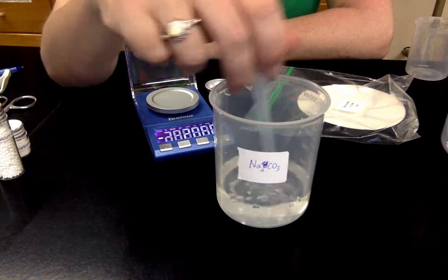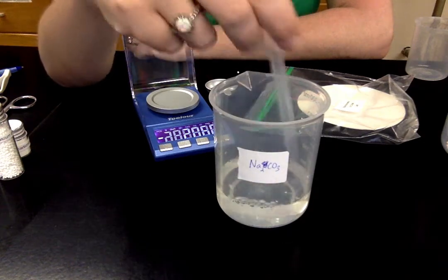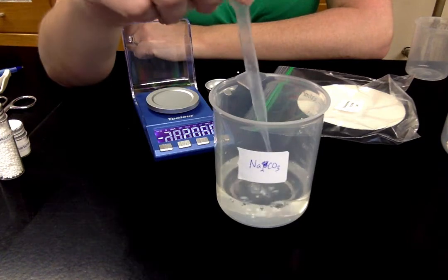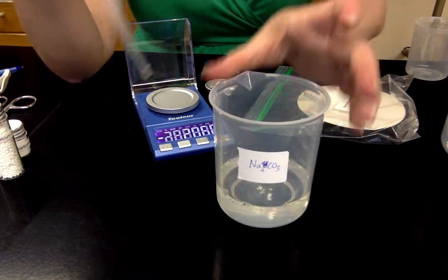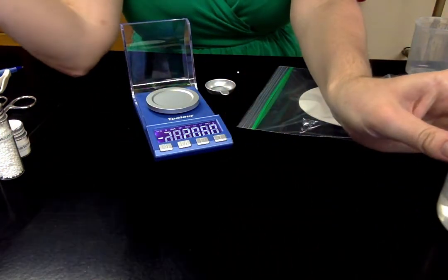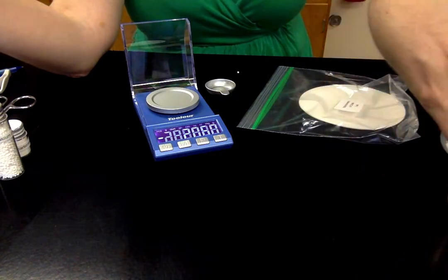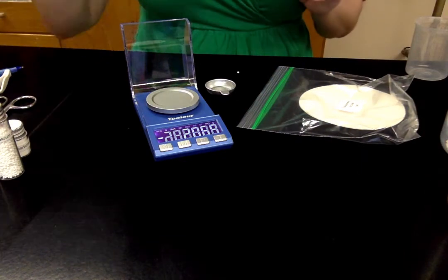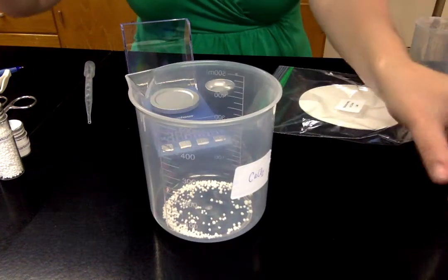But be diligent. I am not because I want to keep this video short. But you want to make sure you stir it until it is all completely dissolved. Then you would wash this out with water, put it in the sink, rinse it with water.